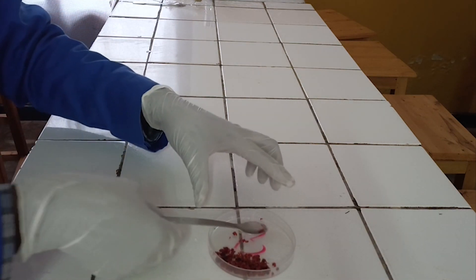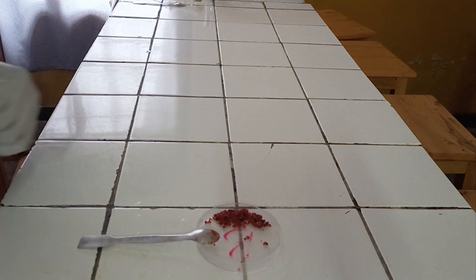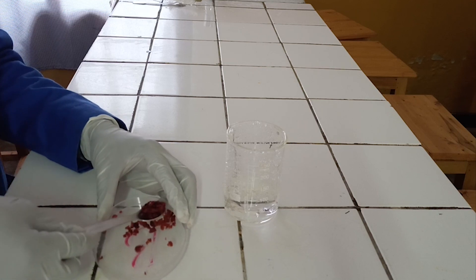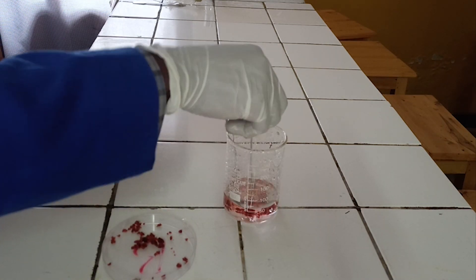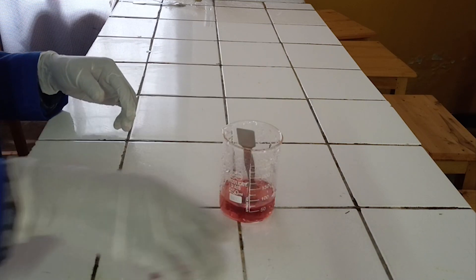Test for cobalt-2 cation. First step is observation. The color of this salt is red. Second step, dissolve a spatula of salt in 50 milliliters of water. When salts of cobalt-2 ion dissolve in water, they form a red solution.